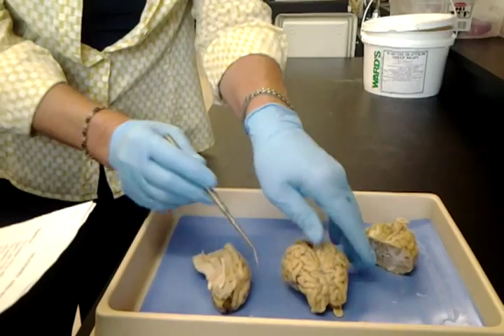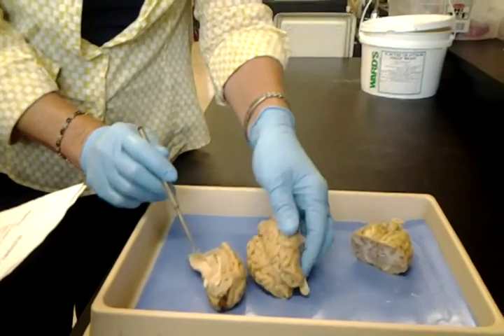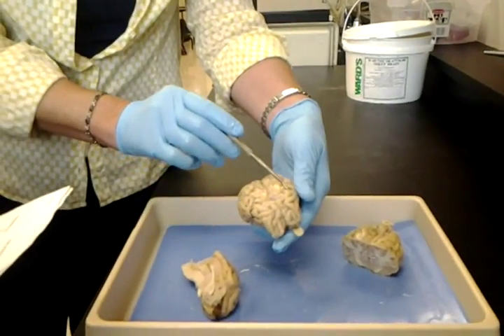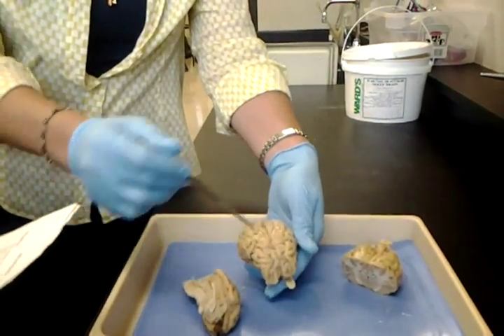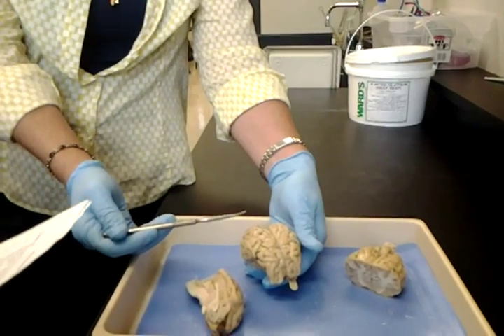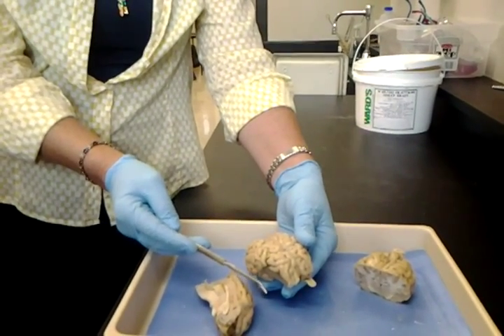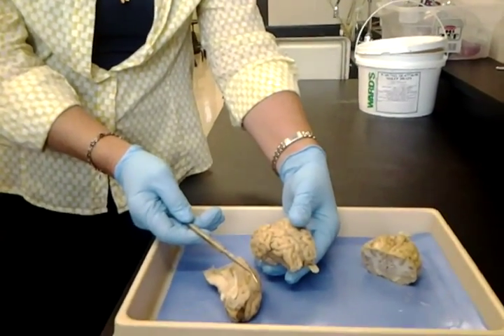Cerebellum, remember, is not the largest part of the brain, excuse me. This is cerebellum, back here, also the hindbrain. Cerebrum is the larger part. So you have right and left hemispheres, cerebral hemispheres. If I ask, what is this large part of the brain? Pin it, cerebrum. We're not going to label the lobes on the sheep brain. It's not as clear what's frontal, occipital, and so on. But cerebellum, cerebrum. You can see central sulcus is not marked on the sheep brain. Let's go to the next one.